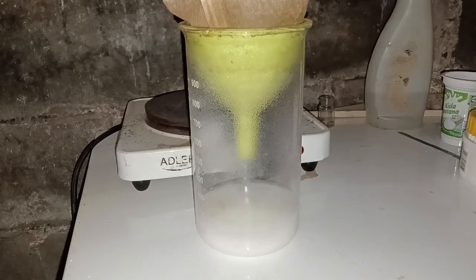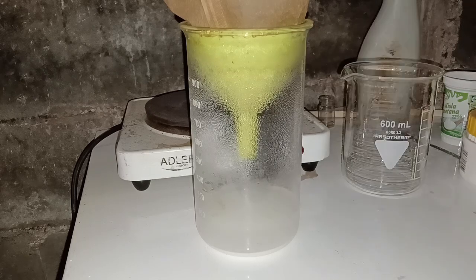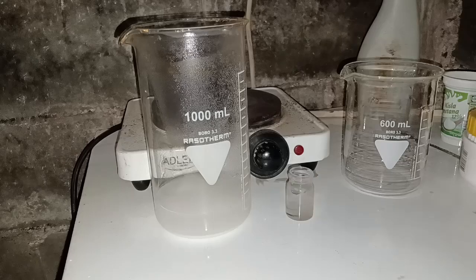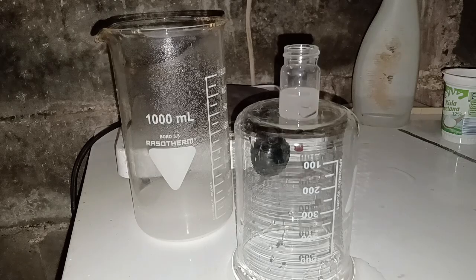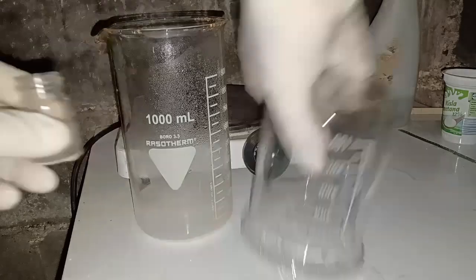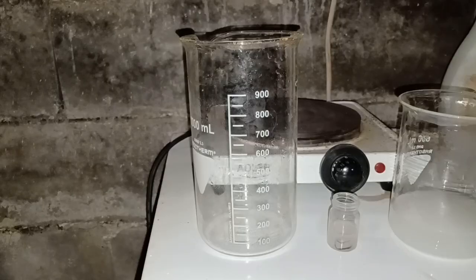Once oxalate settled to the bottom of the beaker, I poured off a bit of the solution into a vial with a piece of copper wire, and I measured the pH. There was no immediate reaction with copper, but the pH strip showed me the value of 1. I made some acid, but it was quite dilute.